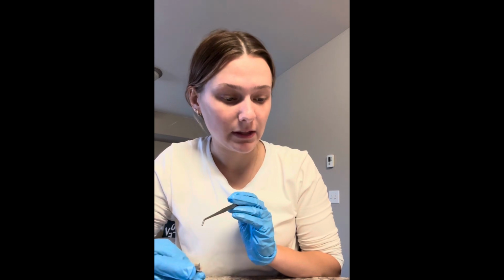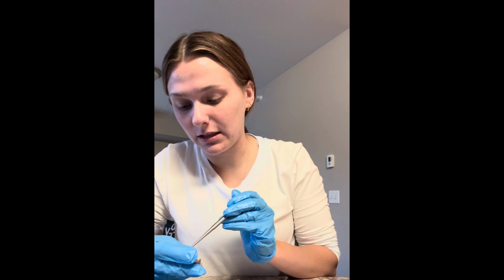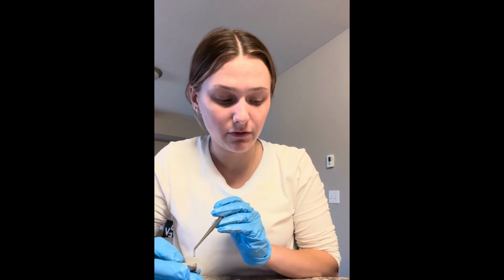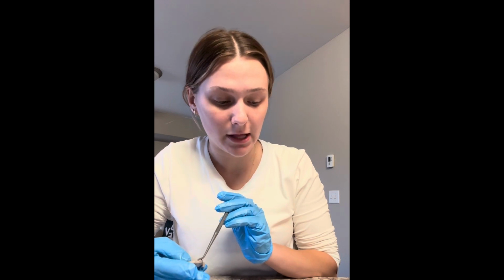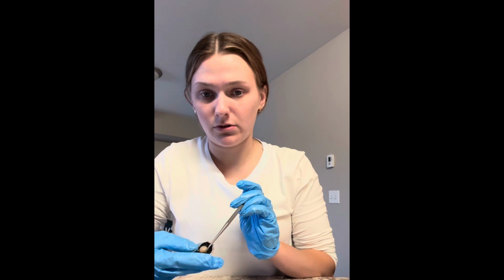Next, I'm going to talk about the aqueous humor. So that lies in between the cornea and the pupil, more in the middle. So the aqueous humor is a clear fluid filling the area between the lens and the cornea, composed mostly of water, and it helps maintain the shape of the eyeball. So that is going to be found within there.